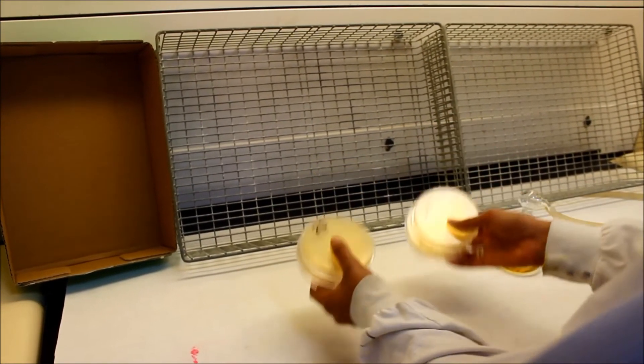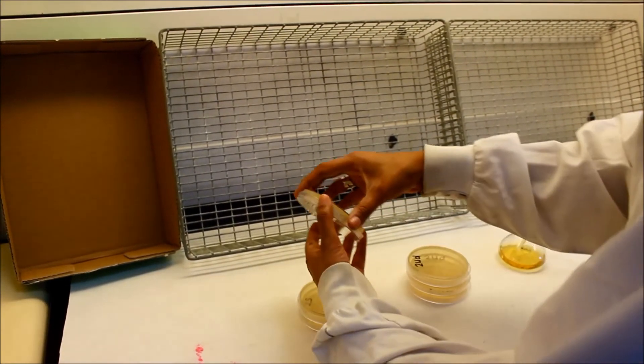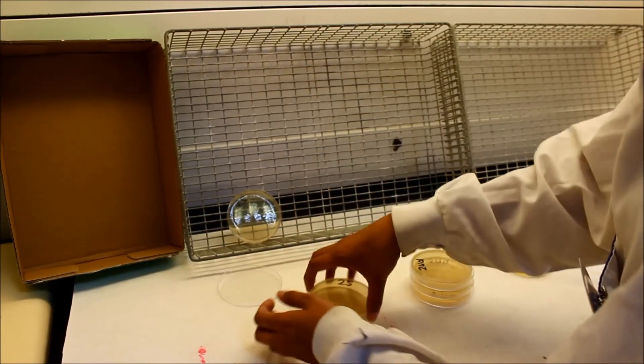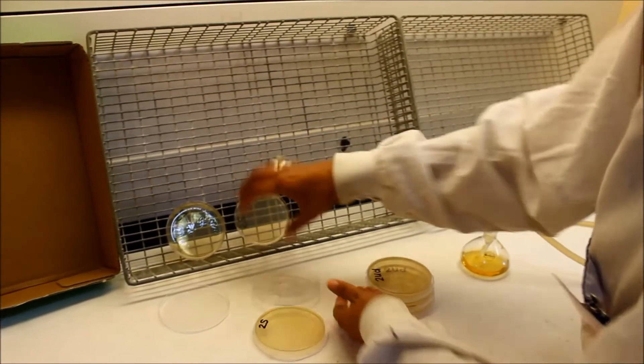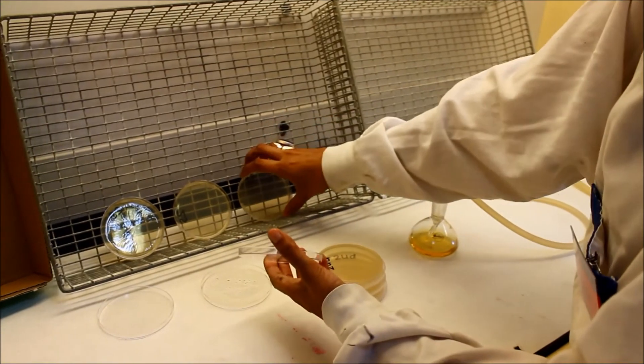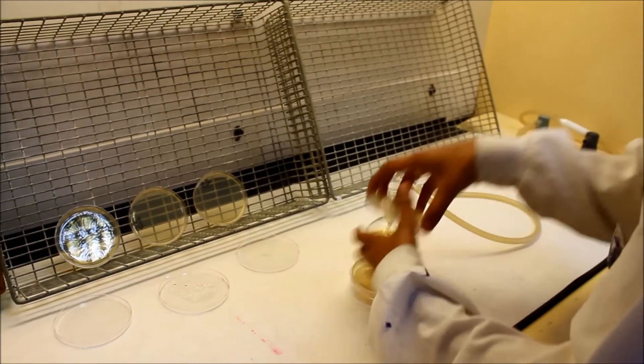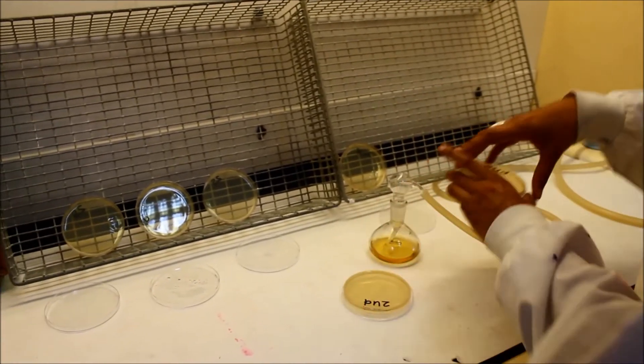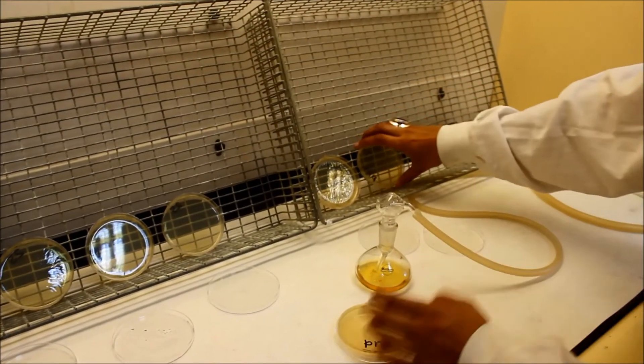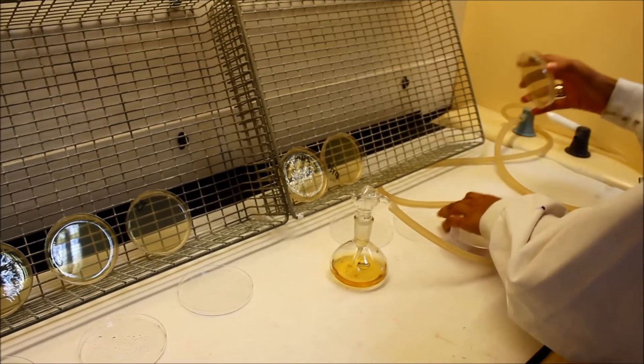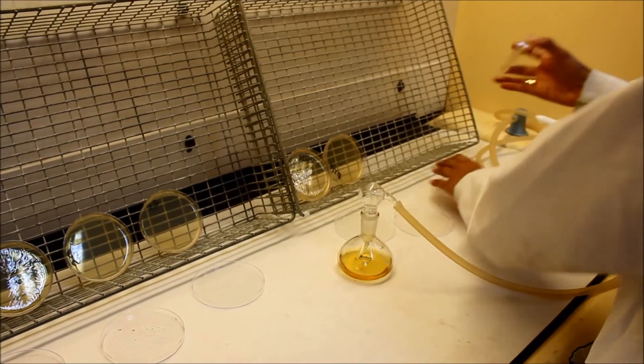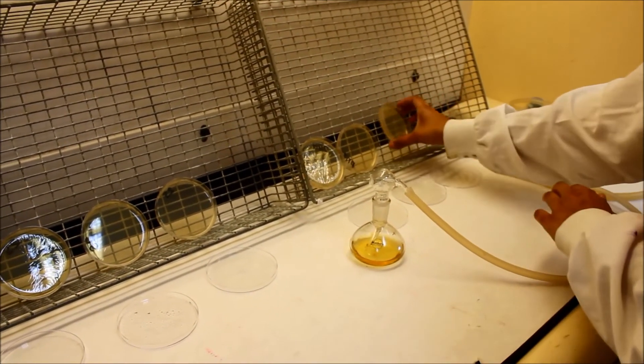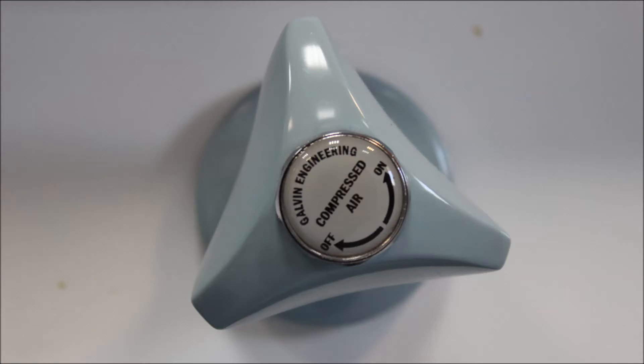Have your 6 plates labeled clearly and ready for spraying. Arrange them with the lids off as shown. Take note of which tap is for the air. It is the one on the left.